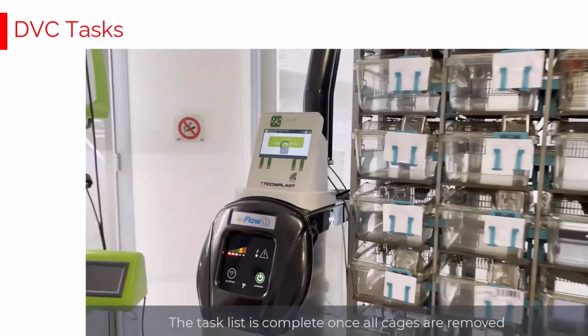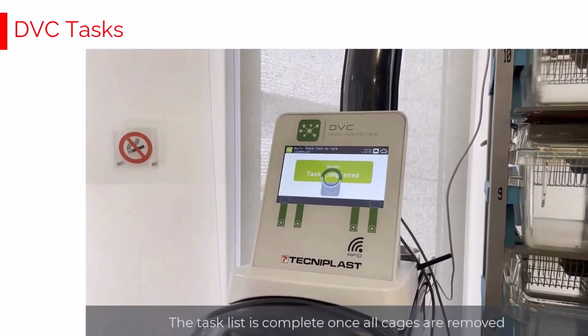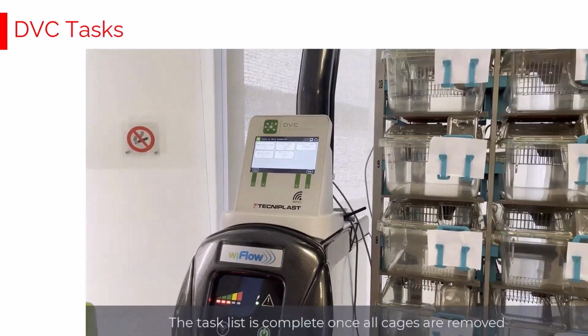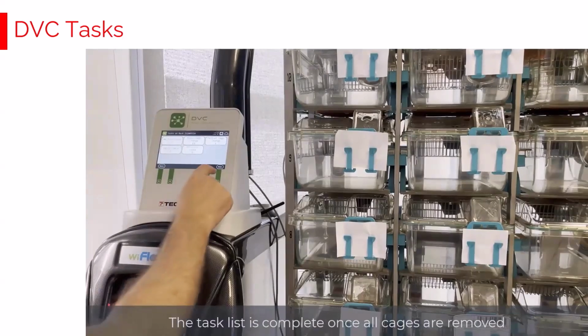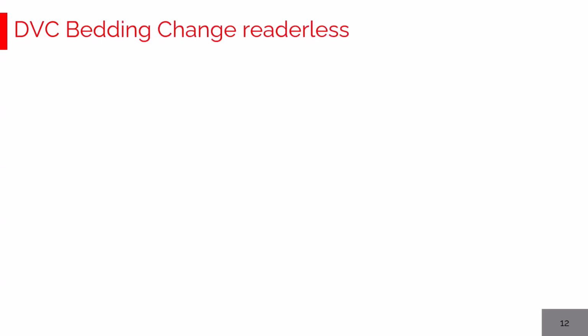When the last one has also been fully and deeply checked, the entire daily check plus welfare tasks are completed, and the master interface is back to the standard visualization. Now, these tasks, daily and welfare, are generated every early morning, as said, and if you like, we can also enable the sending of recapping emails to you, where you can discover if and where these tasks are located.